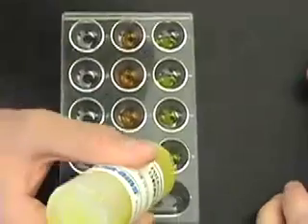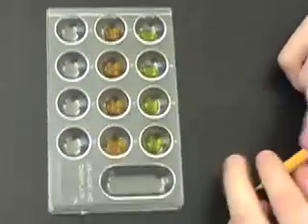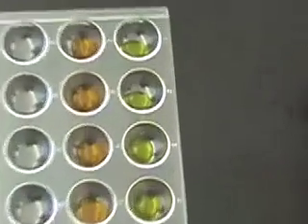At this point in the lab, we have just finished putting the potassium chromate and potassium dichromate into the collection dish. The potassium dichromate can be seen here in orange, and the potassium chromate is yellow. In this portion of the lab, we added the hydrochloric acid to the potassium chromate and the potassium dichromate. The potassium chromate changed from yellow to orange, while the potassium dichromate stayed orange. This is because the hydrogens from the hydrochloric acid pushed the equation to the side of dichromate, which is orange.